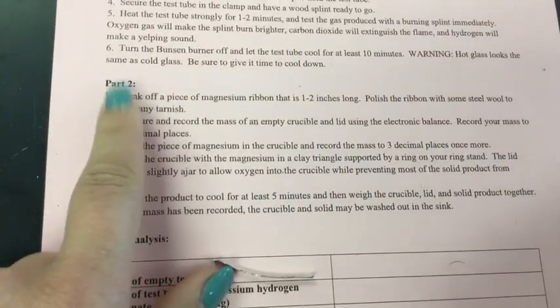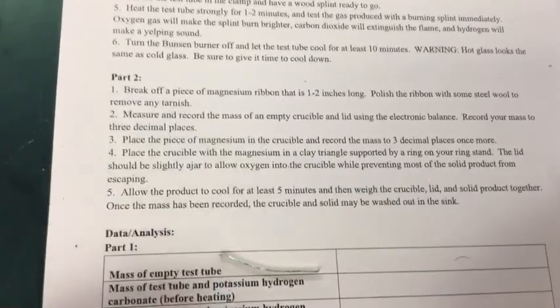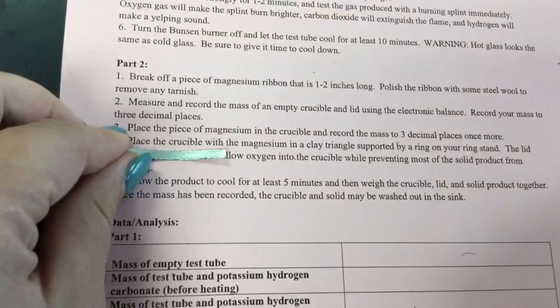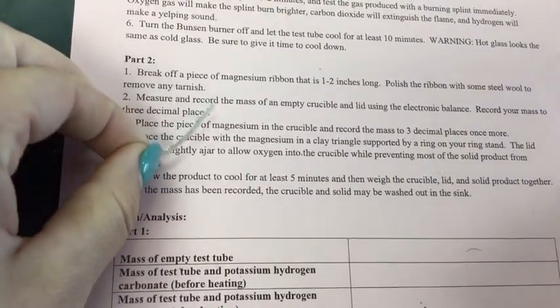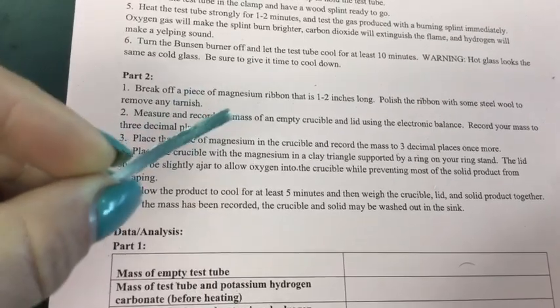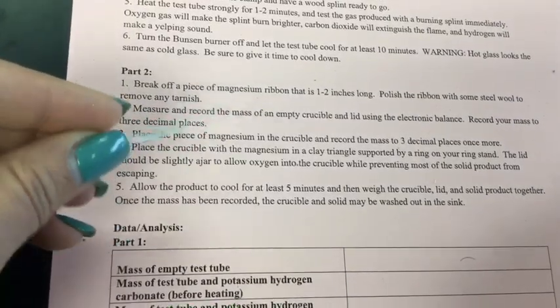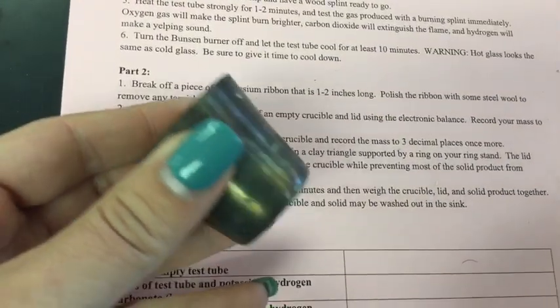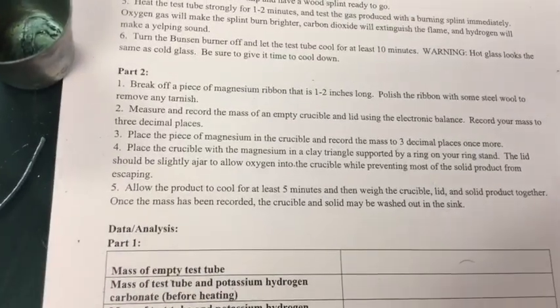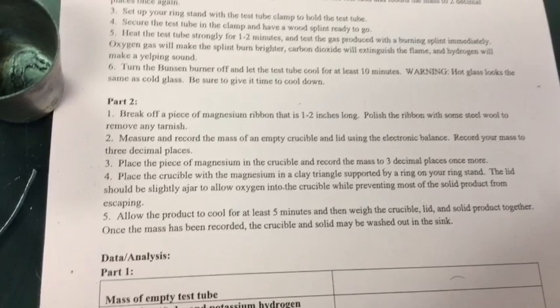Now we're going to move on to part two — this one is probably one of my favorite chemical reactions. Here we have a solid piece of magnesium, and we are going to record how much this and a crucible weighs. A crucible is a little metal cup. We are going to heat it, something really cool is going to happen, and then we're going to let it cool down and weigh it to see what happens.